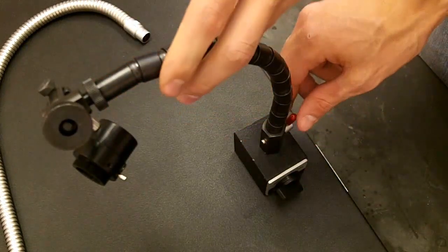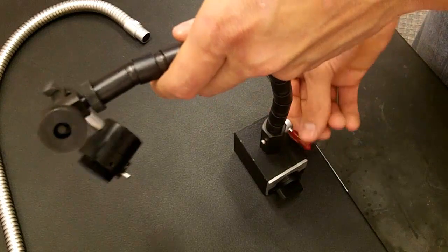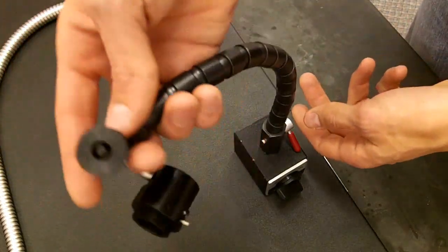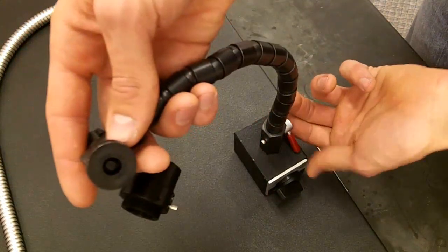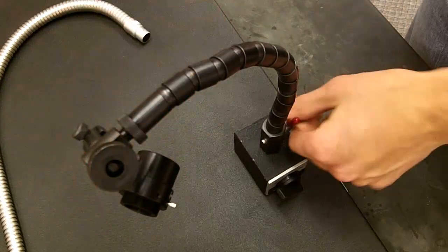This next lever sets the rigidity and position of the arm. Turning it towards the base loosens the arm and then turning it to a vertical position solidifies the arm.